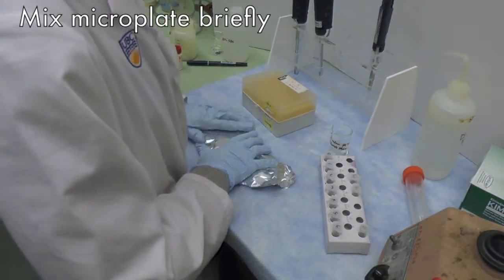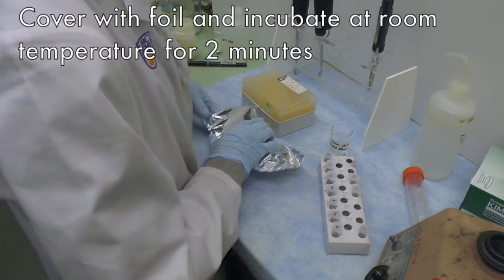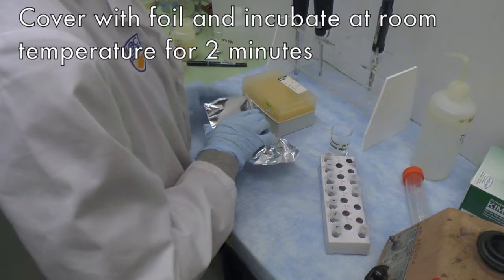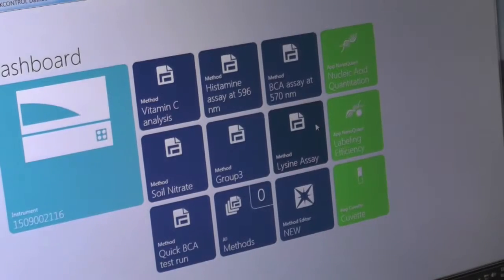Mix briefly by moving the microplate up and down. Cover the microplate with aluminum foil and incubate the plate for 2 minutes at room temperature.